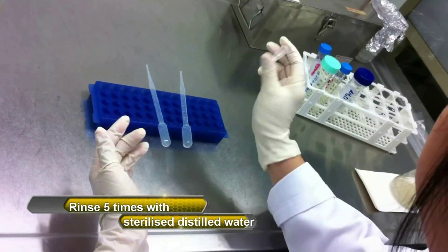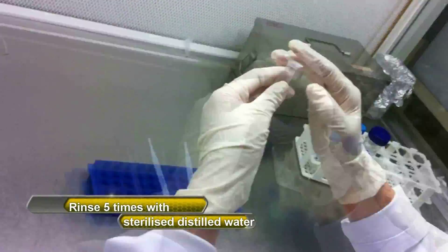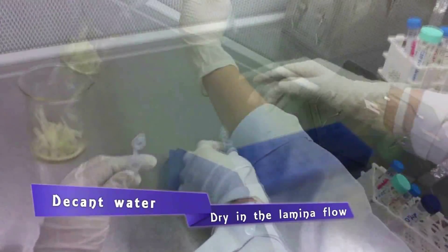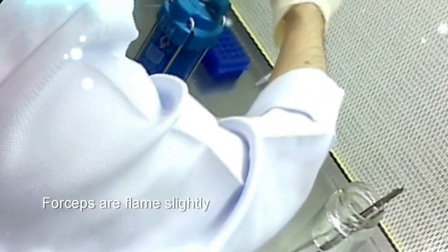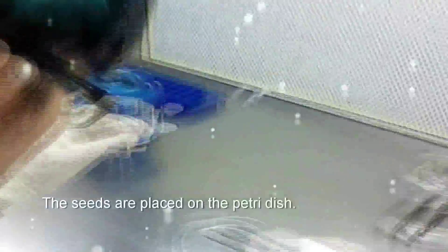Rinse the seeds 5 times with autoclaved distilled water. Next, decant the water and the seeds are left to dry for a while in the laminar airflow. The seeds are then ready for in vitro culture. Remember the seeds need to be dried properly before doing the in vitro culture. Using the aseptic technique as demonstrated, 3 seeds each are then inoculated into a conical flask containing half-strength MSO medium, for a total of 6 seeds in 2 bottles.